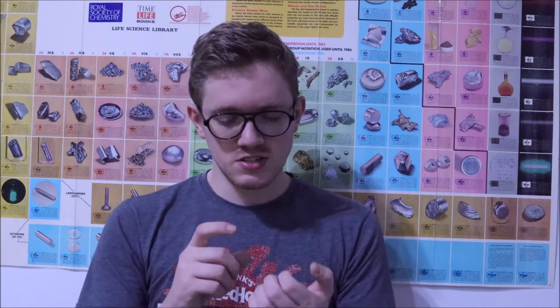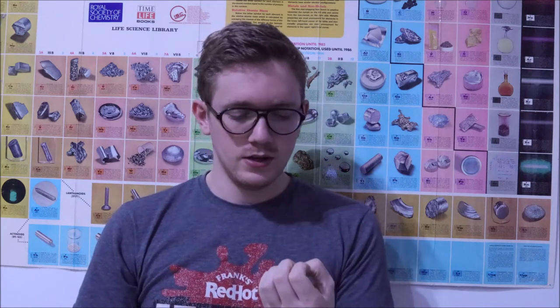Hey people, today I'm going to be doing something a bit out of the ordinary. I'm going to be using my own hair that I just had removed, and I'm going to do my best to isolate the proteins that are found in hair. Now as you may or may not know, hair is composed of the protein keratin, which is the same material that your fingernails are made out of.